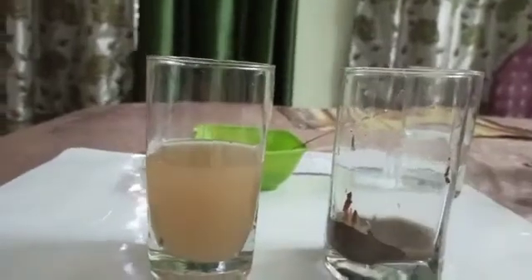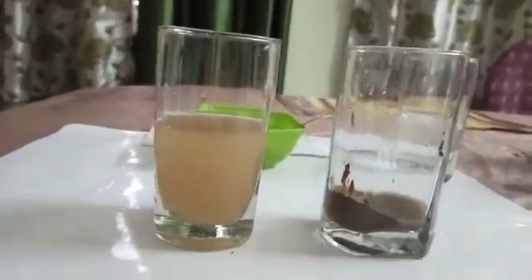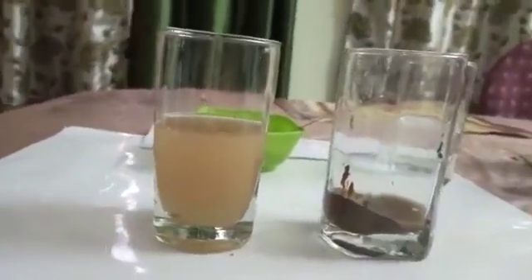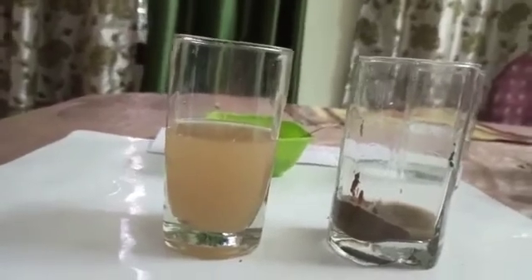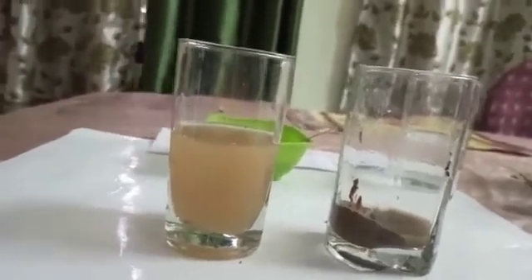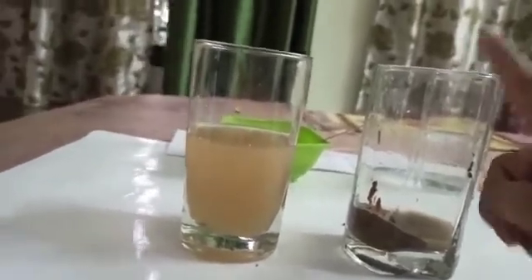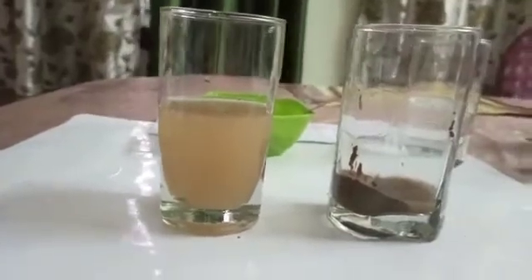Now we observe that the mixture of sand and water can be separated. We have seen that sand and water can be separated by the process of sedimentation and decantation.